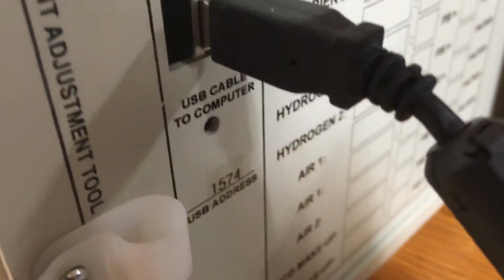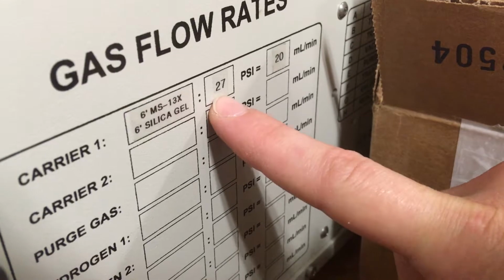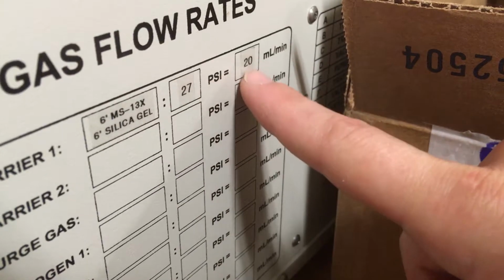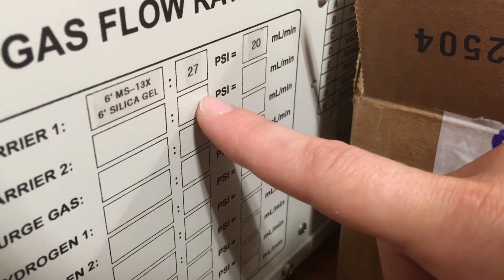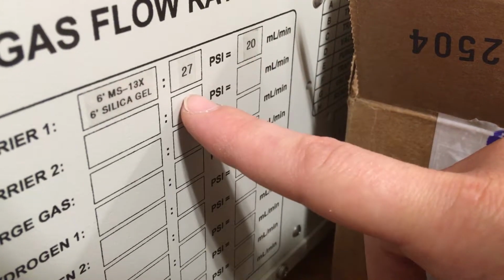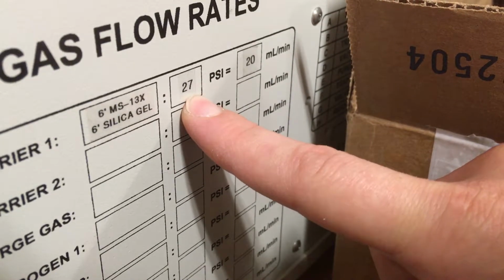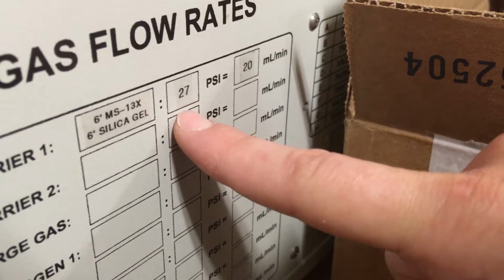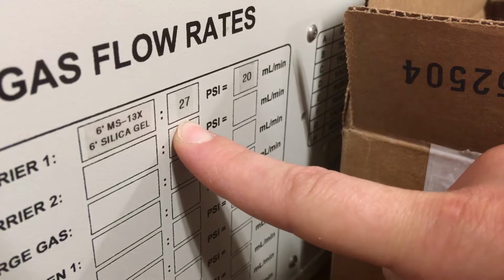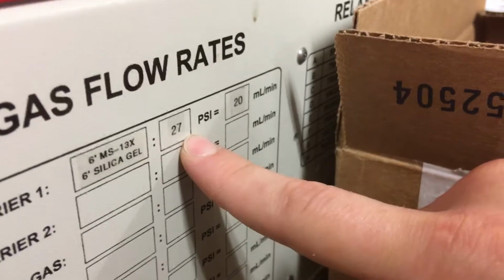And that's right, yeah. And if you look, while we're looking at the side, this is also telling you, I mentioned earlier there's a flow rate. For this particular instrument at 27 psi, it's expected to go 20 milliliters per minute. You will see many different things on the internet that tell you many different flow rates for many different pressures that don't correlate to this. So if you're going to reference anything, do not reference from the internet, reference from the instrument, because this is correct. And some people who are even experts in this instrument, they will tell you that you're wrong for running it at this pressure, and they are the ones that are wrong.